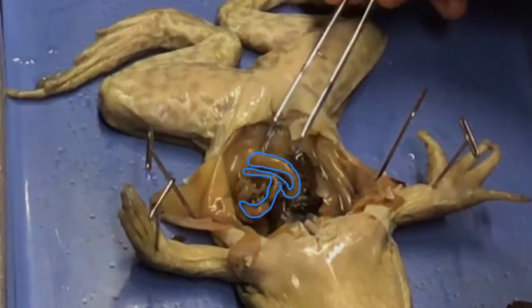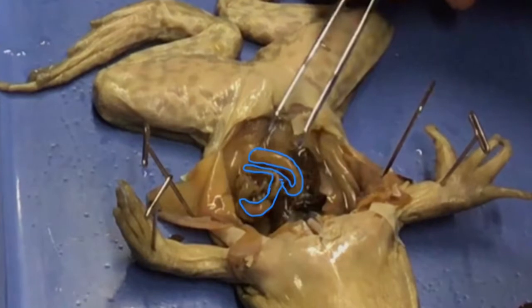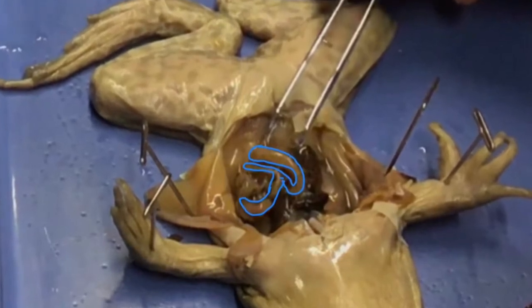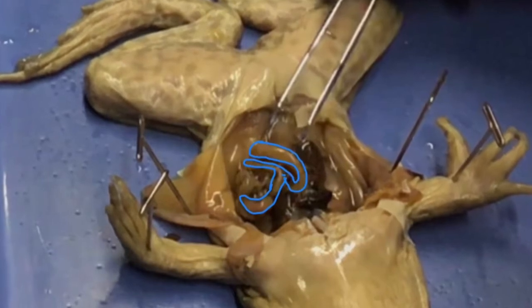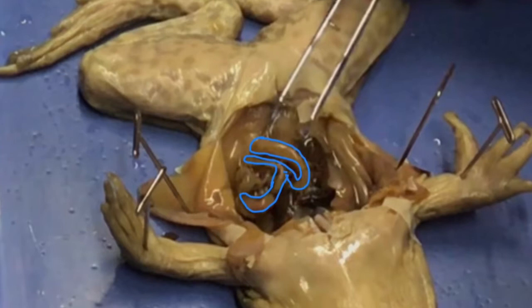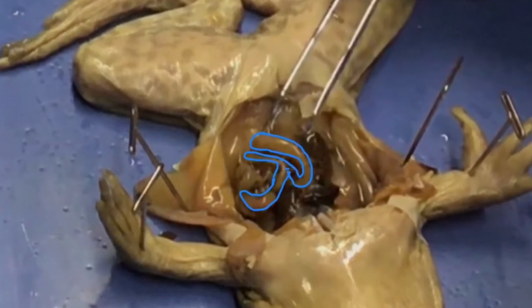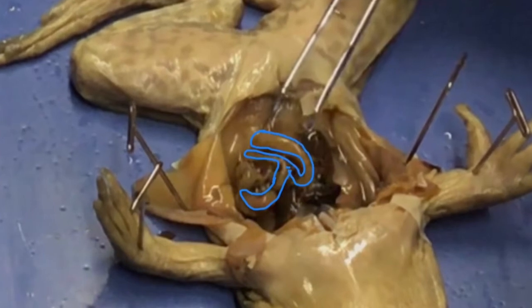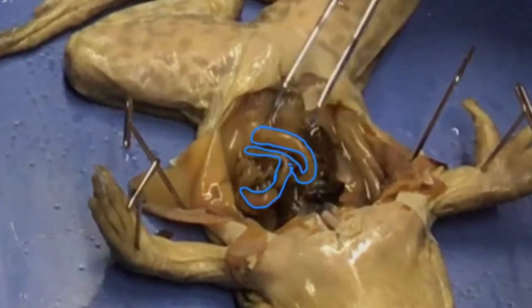The small intestine is a hollow tube that is coiled up in the abdominal cavity. It starts at the duodenum and ends at the large intestine. The small intestine is made up of 4 layers: the mucosa, submucosa, muscularis, and serosa. The mucosa is the innermost layer that is covered in villi that help it absorb nutrients from digested food. The submucosa contains blood vessels and nerves. The muscularis helps move food through the small intestine, and the serosa protects and encases the small intestine. The function of the small intestine is to digest food and absorb nutrients such as vitamins and minerals.